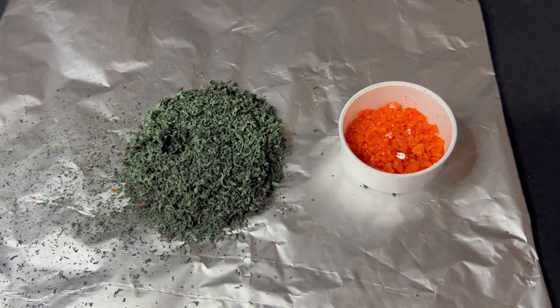This demonstrates a thermal decomposition reaction, as one compound has broken down into simpler products, and it also involves redox changes. Chromium has been reduced from +6 to +3, and the ammonium ions have been oxidised. So the decomposition of ammonium dichromate is an excellent example of both a decomposition and a redox reaction.